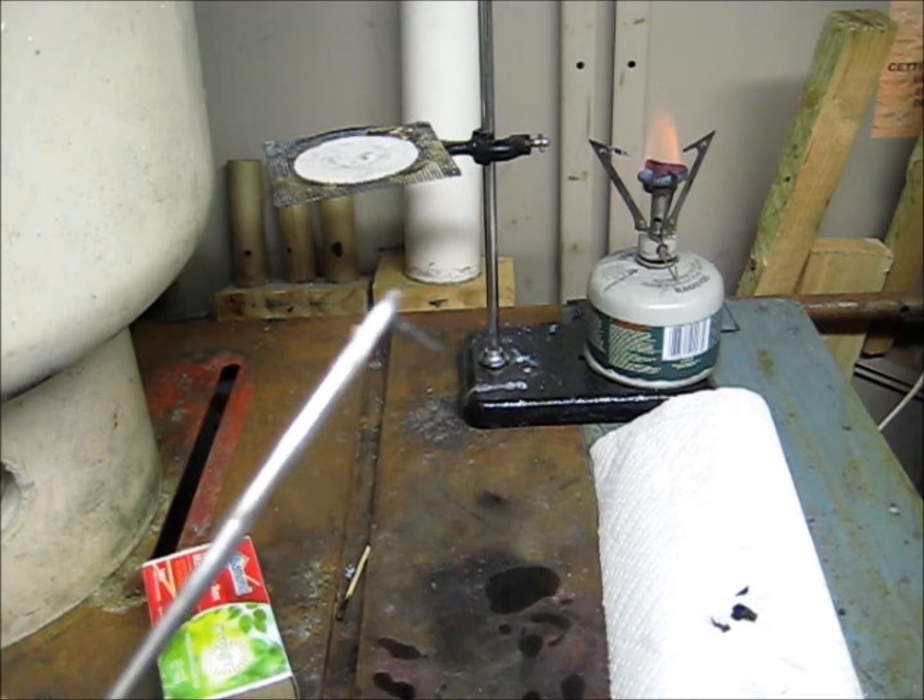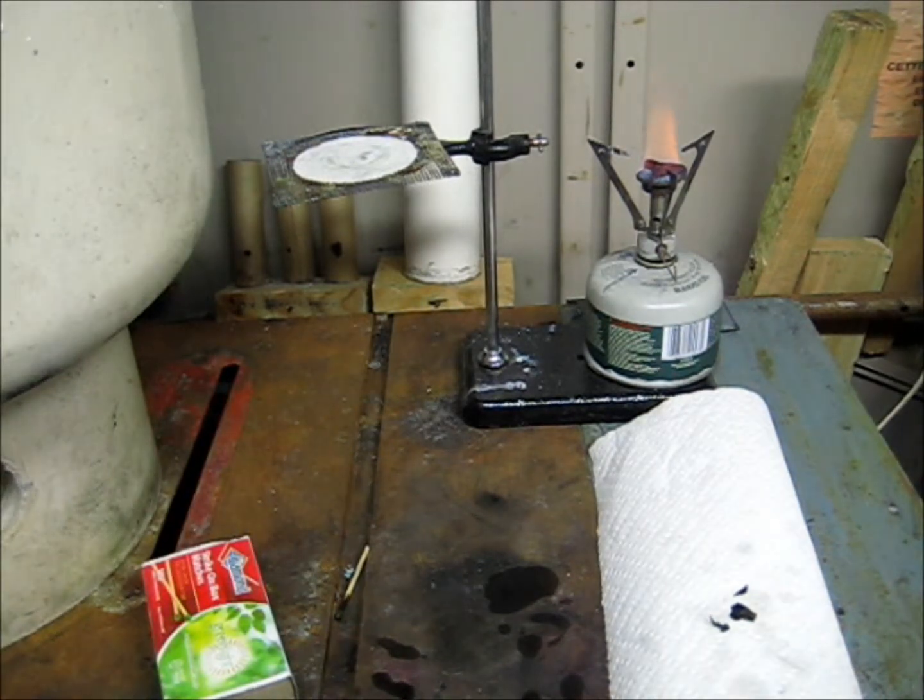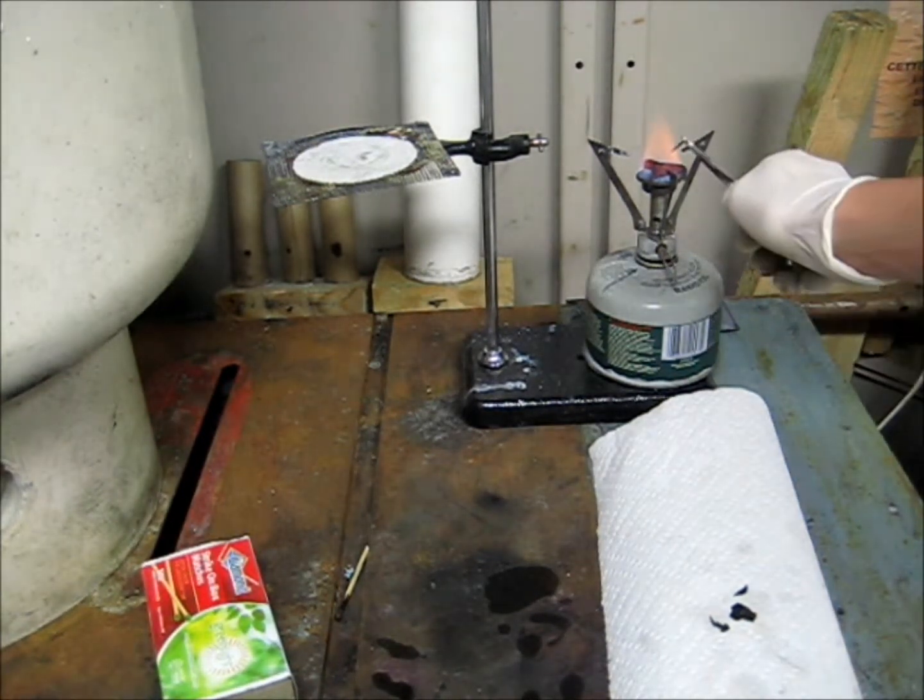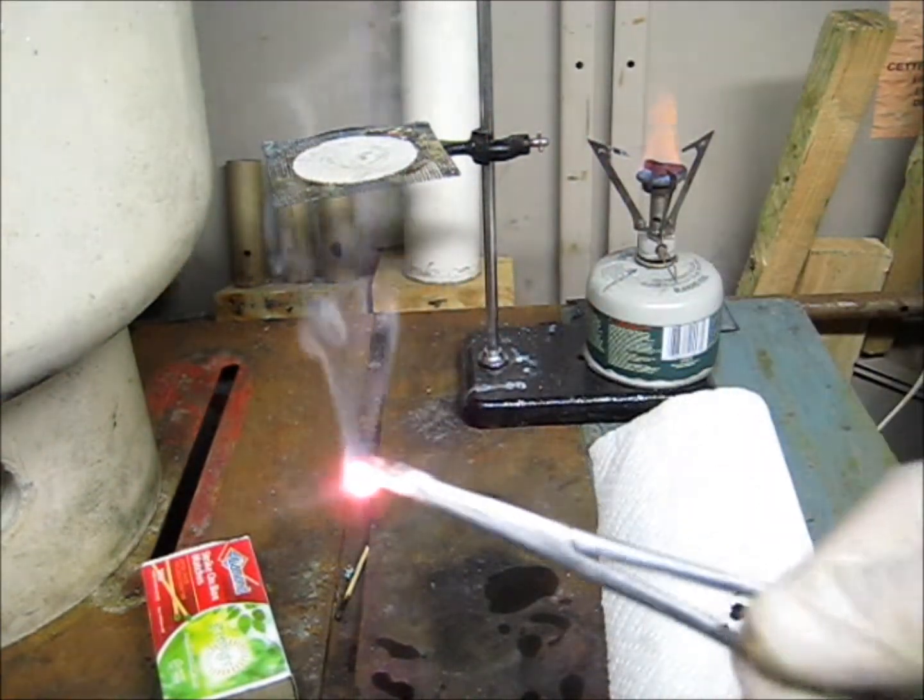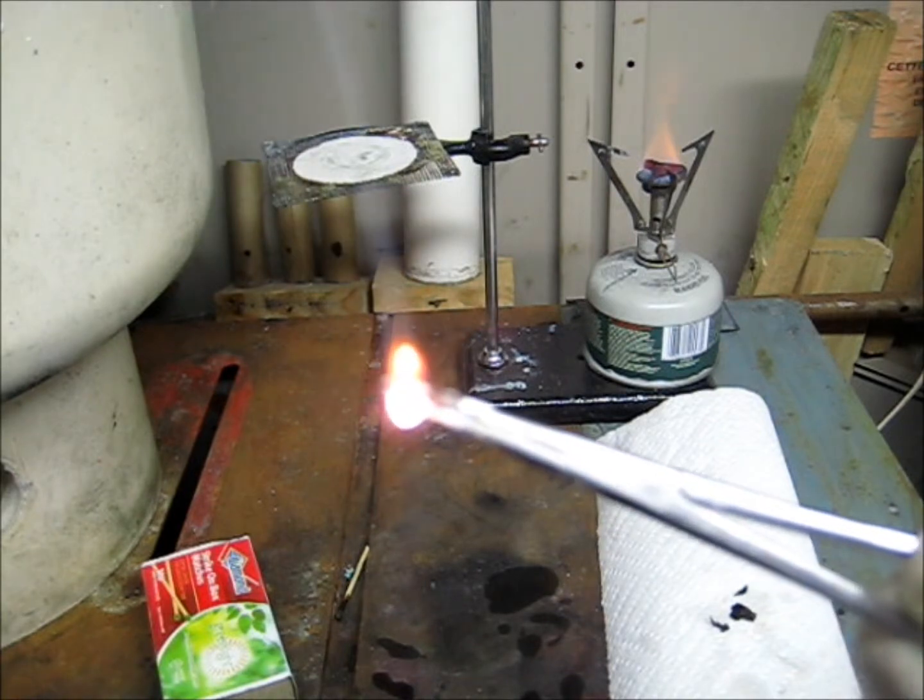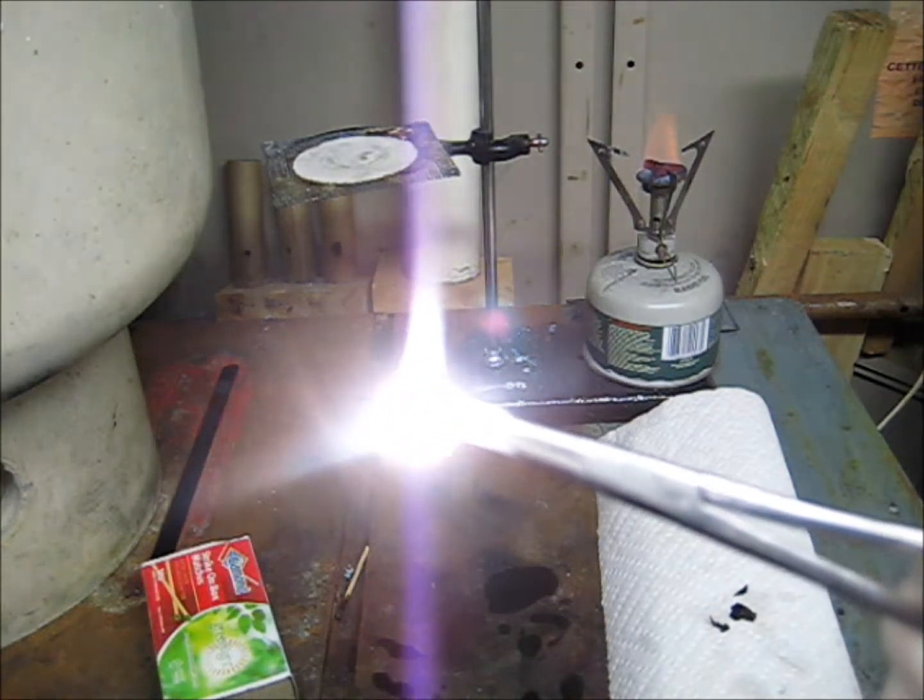So here I'm just going to burn this small sample and as you can see it burns a little like magnesium, but the properties are different. White flame but you can kind of see a little red in there also.